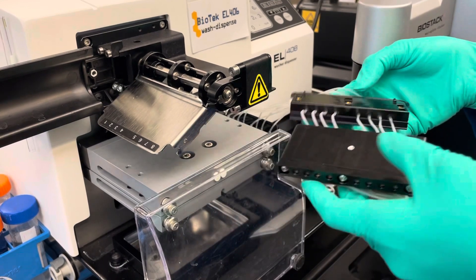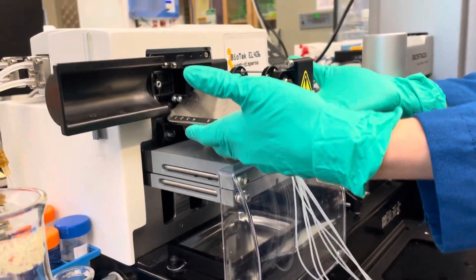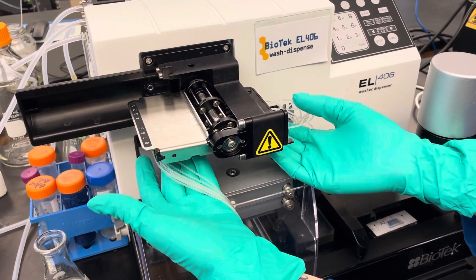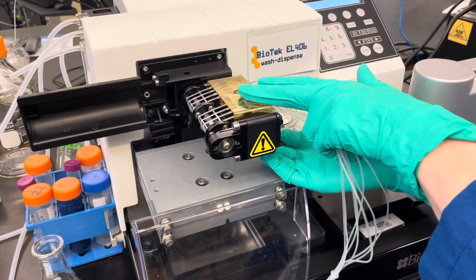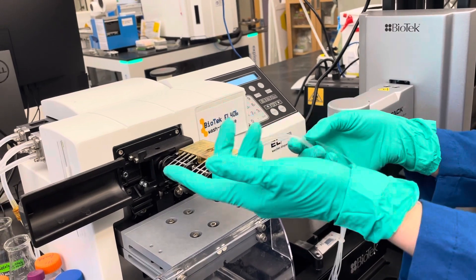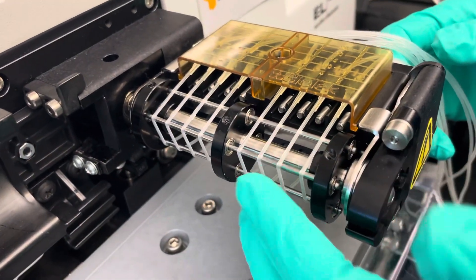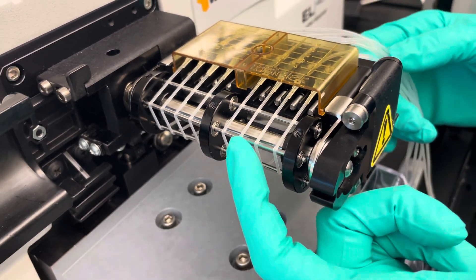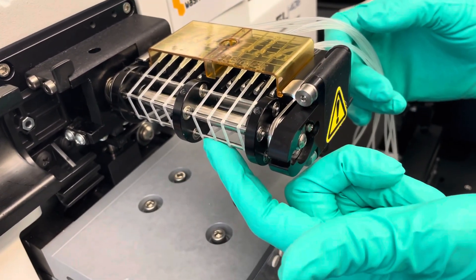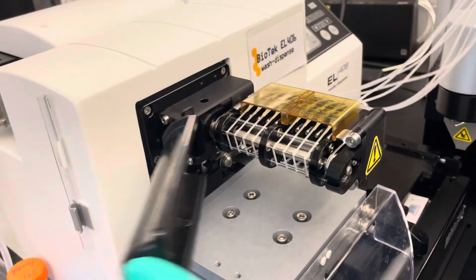Then you gently bring the other parts below the pump. The piece on the right kind of slides into place where it needs to go. The left one you can feel when it's in the right place, and then you close this sandwich. You do have to apply some tension when doing that — it's not a lot, but don't be scared. Make sure these tubes are straight, because their position on the barrel is what determines the volume being dispensed. The little piece of liquid between the spokes of the barrel is called the slug volume. The tension on the tubes combined with the tube diameter and distance determines what volume will be dispensed.